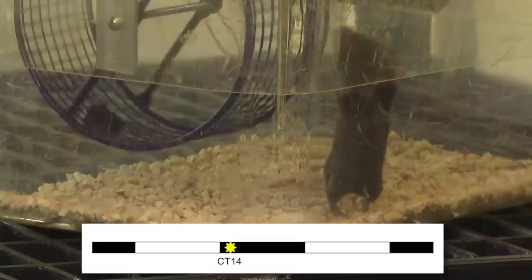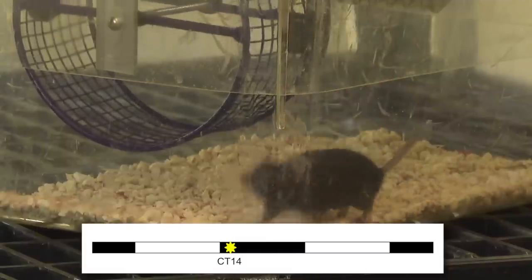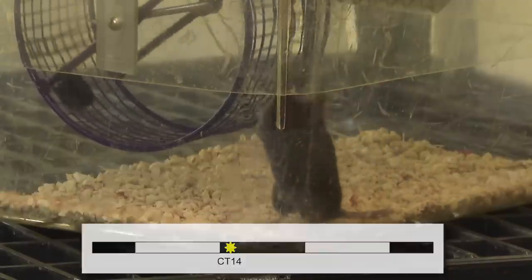We'll continue to monitor activity in continuous darkness for 20 days. On the seventh day of that 20-day cycle, we'll provide a light stimulus of about 100 lux — which is normal room light intensity — for 60 minutes at circadian time 14, or CT14, in order to observe the effect that the light pulse has on their activity rhythms.